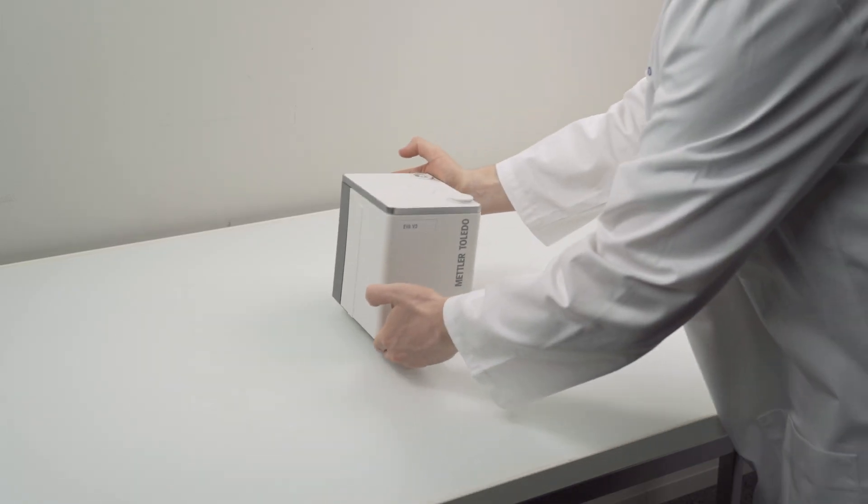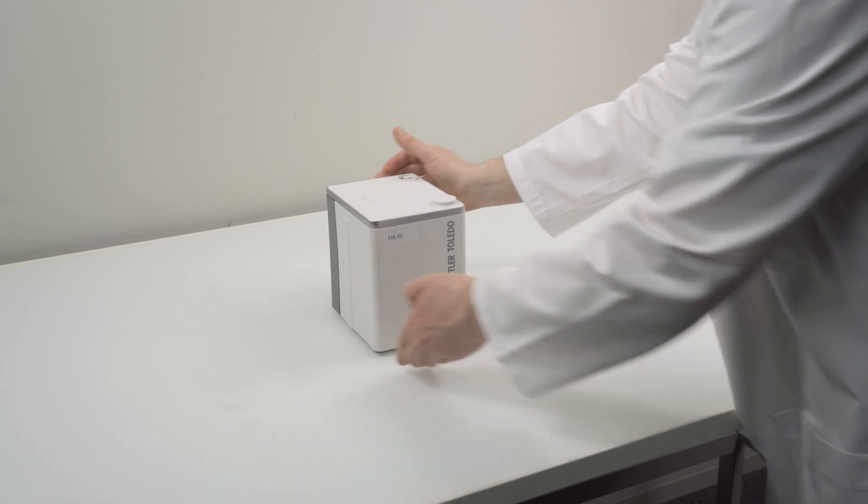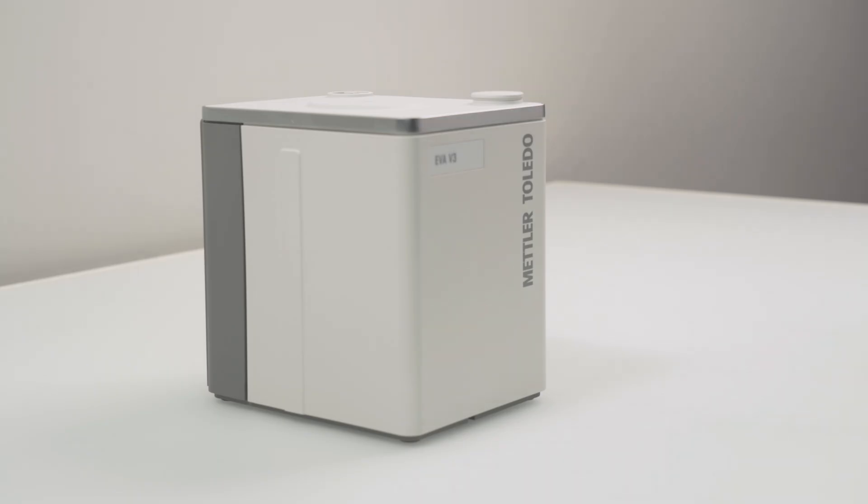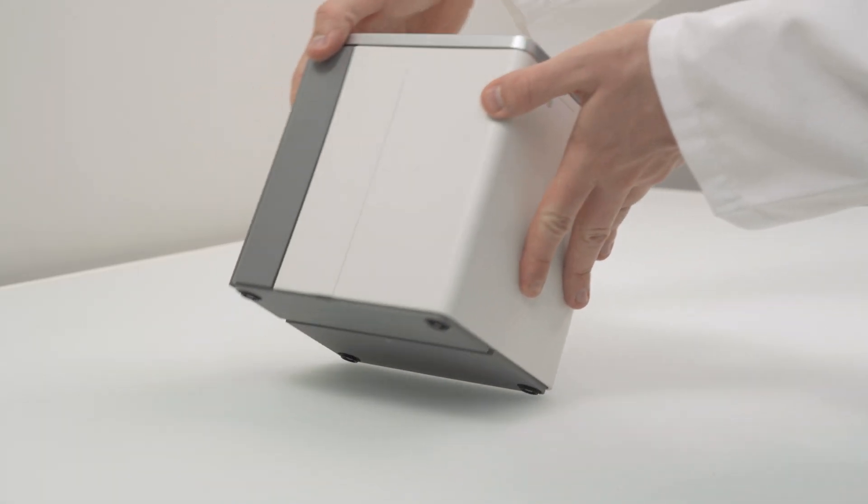We start with the installation of main unit and terminal. Take the main unit and place it on a solid reliable table in a well-ventilated room or even better a fume hood.